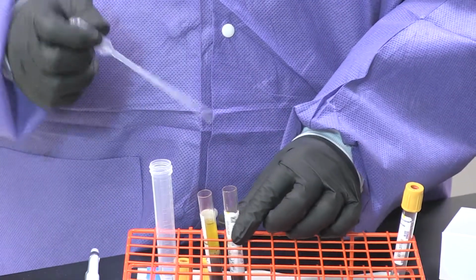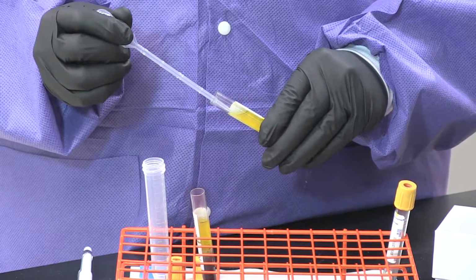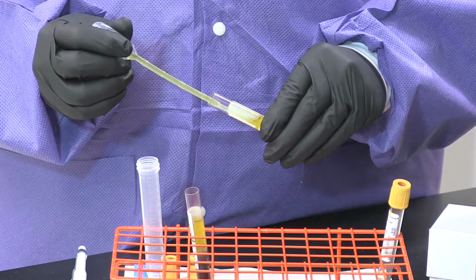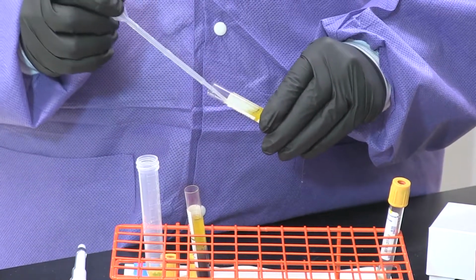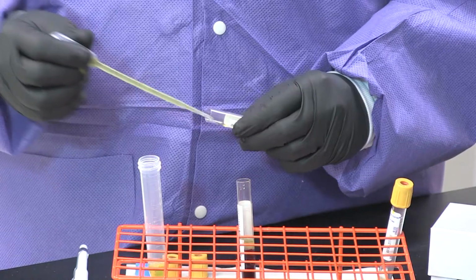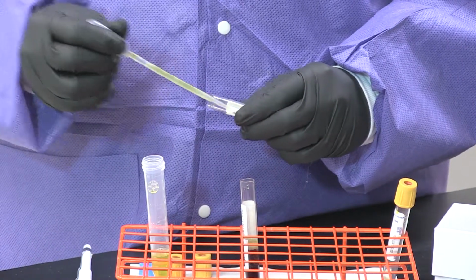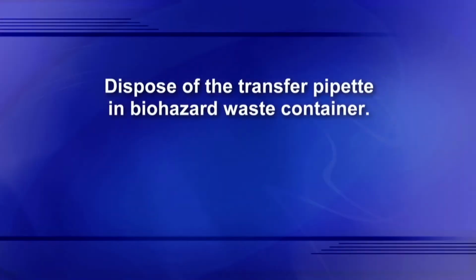Transfer the serum using the transfer pipette provided. Draw up the serum and transfer to the 15 ml conical tube. Repeat this process for the second tube. Dispose of your pipette into the appropriate biohazard waste container.